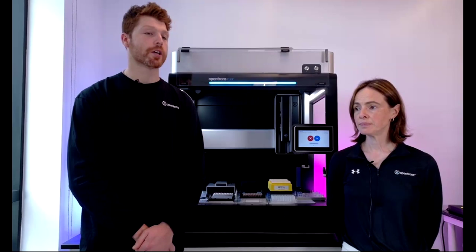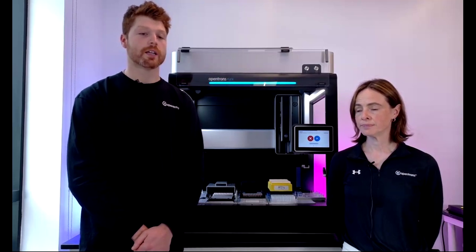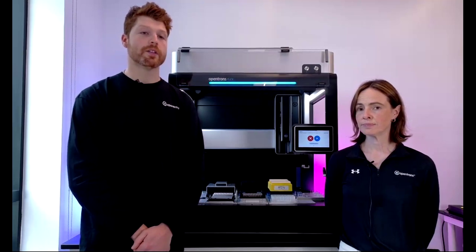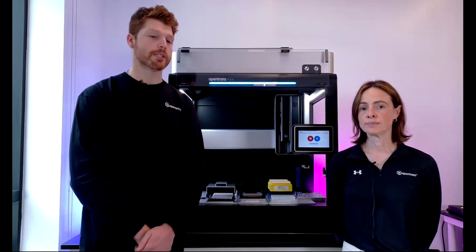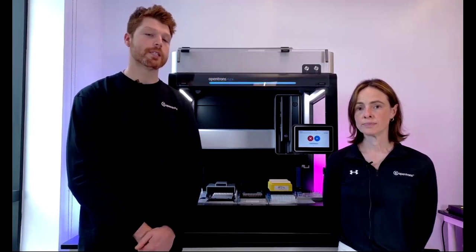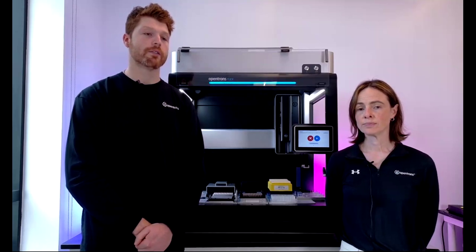So yes, it is definitely a good idea to take a look at the relevant labware and reservoirs that you want to be using and what their chemical makeup is, as well as what the chemical makeup of the tips is, and then also the relevant makeup of the pipettes. Hopefully with filtered tips, none of that will ever come in contact. But the other relevant piece is also to ensure things such as vapor pressure and all of those things, which in the organic and inorganic solvent world can also cause issues down the line.